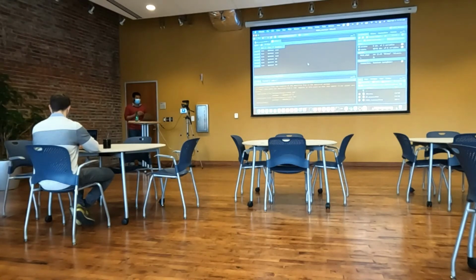I've gone through the book, and I know this is just toy data, but I don't think they actually say what was knocked down. So just imagine your favorite gene was knocked down in these cells. And so that's all that colData is. So on line 41, if you want to write down what you should write down, you can just type in colData. And if you just run that, we can see the contents.